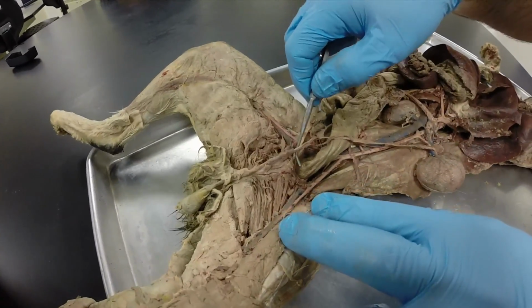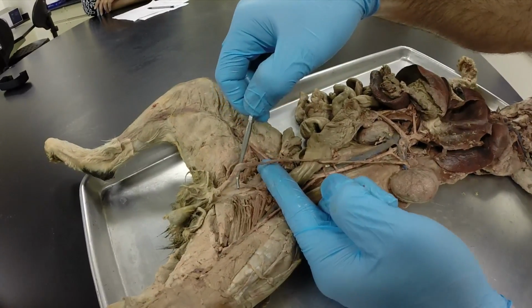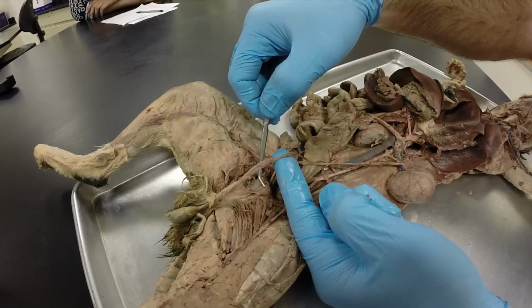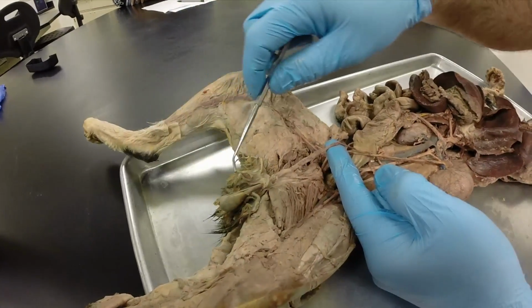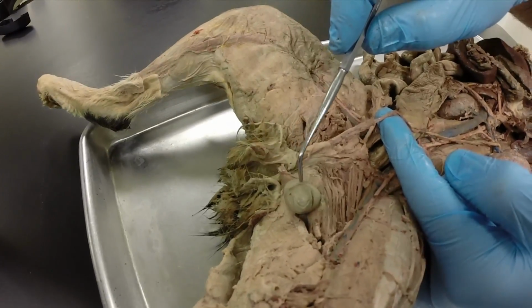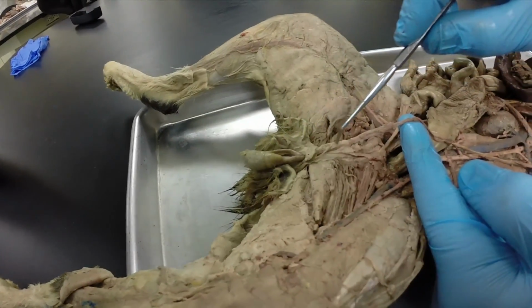And since this is a male cat, we can look at a few male parts. If you look here, this is the gonadal artery coming down. And at this point, we call this structure the spermatic cord. The spermatic cord basically has arteries, veins, nerves, lymphatics, and the ductus deferens passing through it. And you can see how this is connected right to that testicle right there. So this is the testicle, and you can also see the epididymis right there. That's the head of the epididymis, the body of the epididymis, and then as it curves around, the tail. And then this is our ductus deferens, which is running up this way.